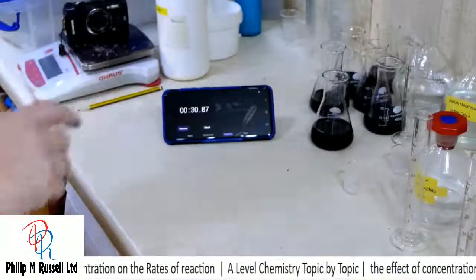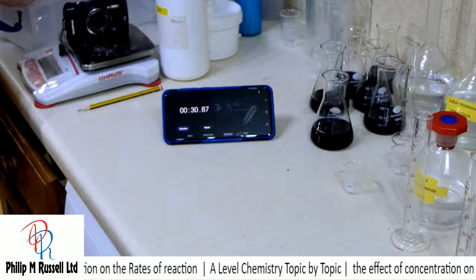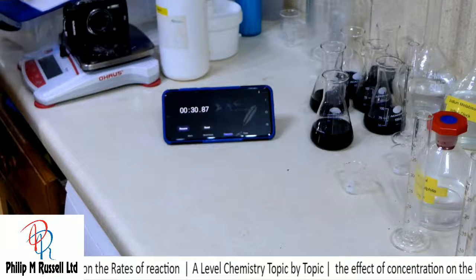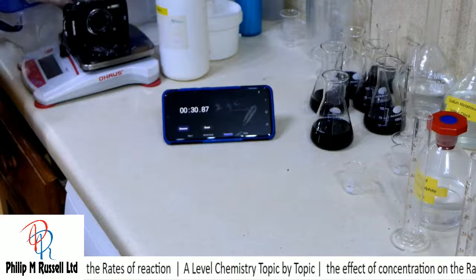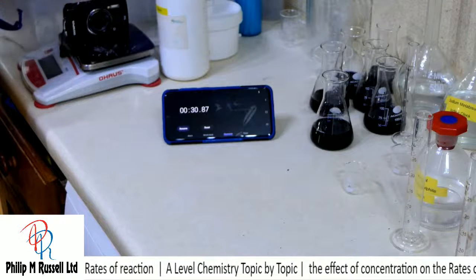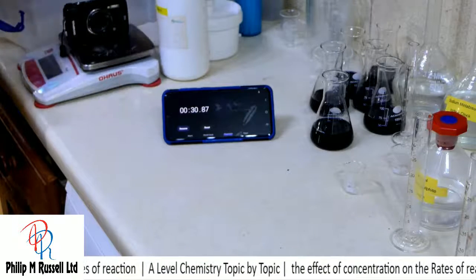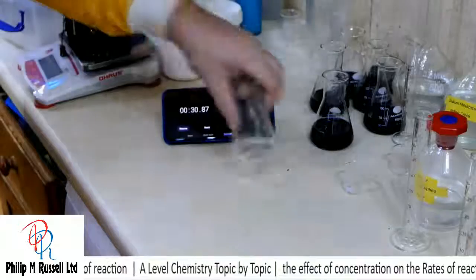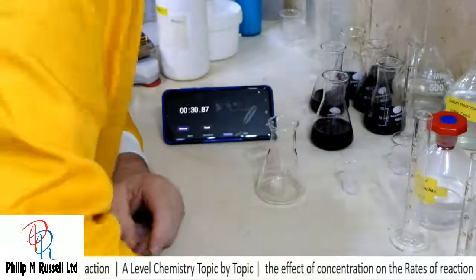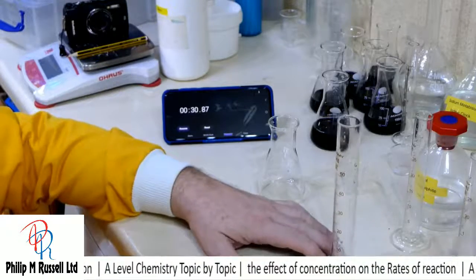Right, so we can try increasing the time. Let's increase the time by increasing the amount of liquid in there. So this time let's go for 40 mils of water.